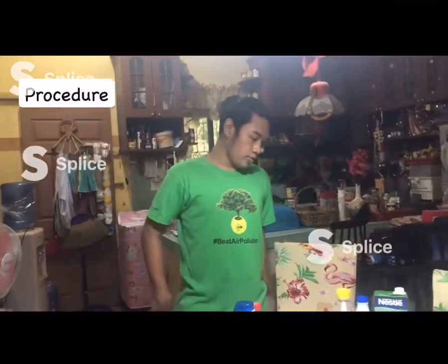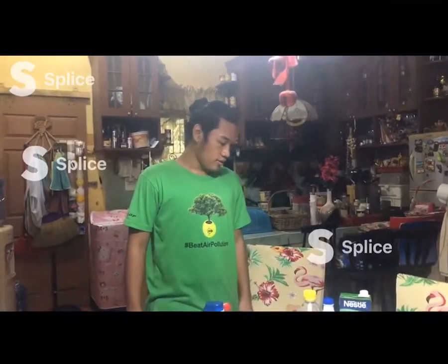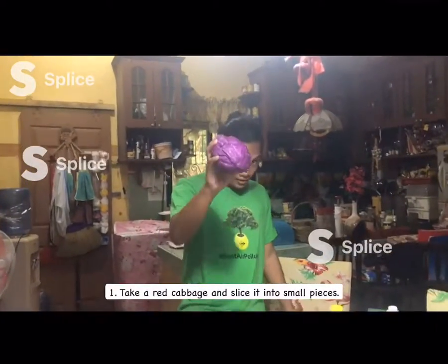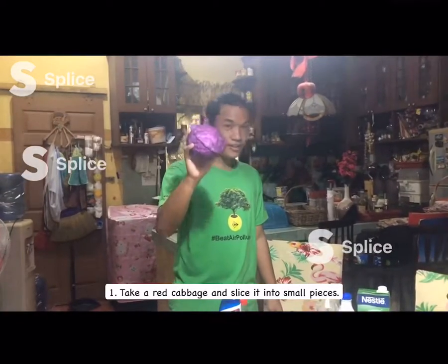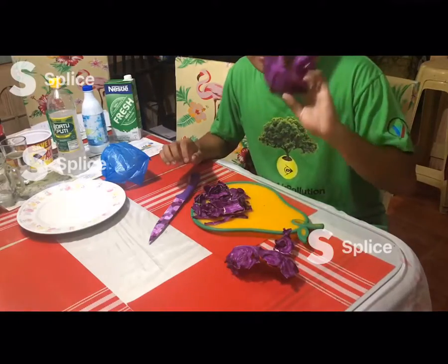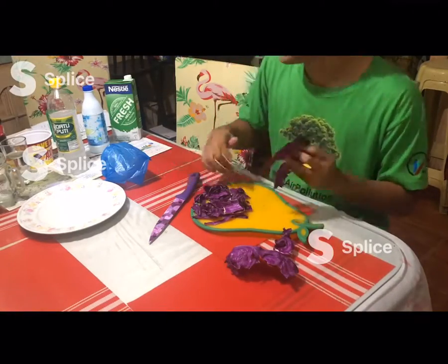So we proceed to procedure number 1. Take the red cabbage and slice it into small pieces. So now I will cut the red cabbage into small pieces.